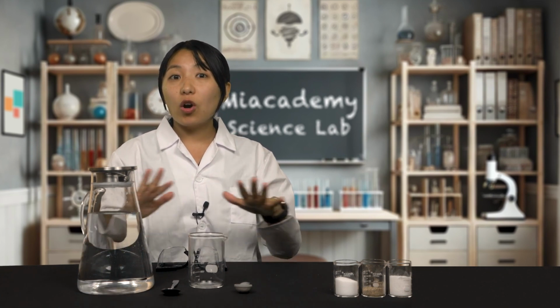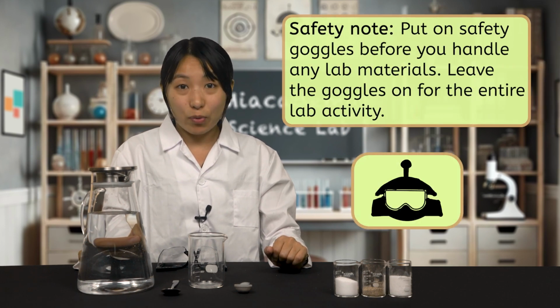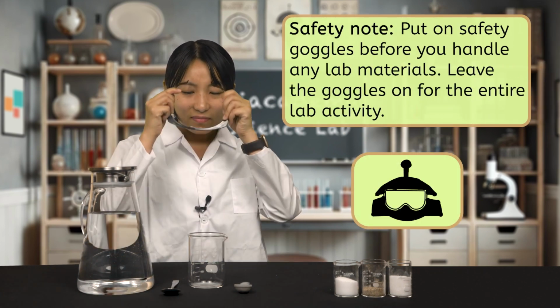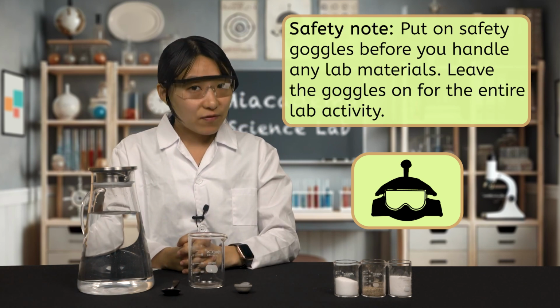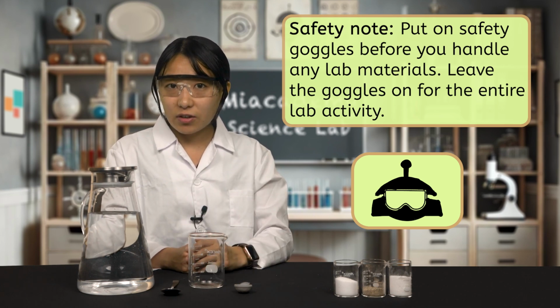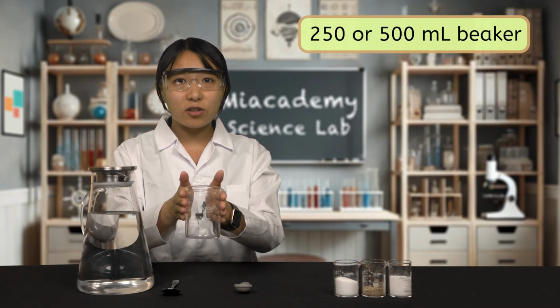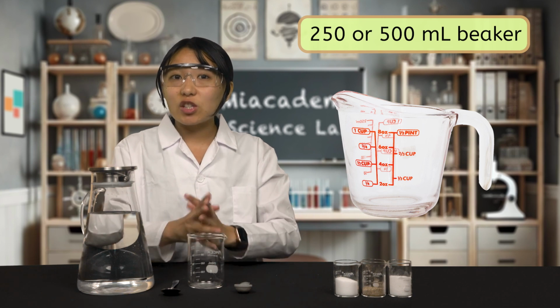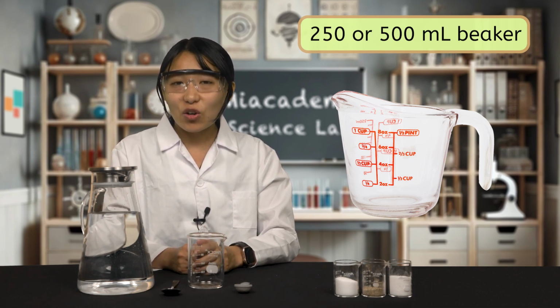Let's take a moment to get all of these materials organized and ready. I'm going to put on my safety goggles before we begin. It's very important to put on your goggles before you handle any of the lab materials and leave them on for the entire lab activity. Our first material is a 250 or 500 milliliter glass beaker. I'll be using one that is 250 milliliters, but you can use any beaker, measuring cup, or glass that holds at least 250 milliliters or 1 cup.